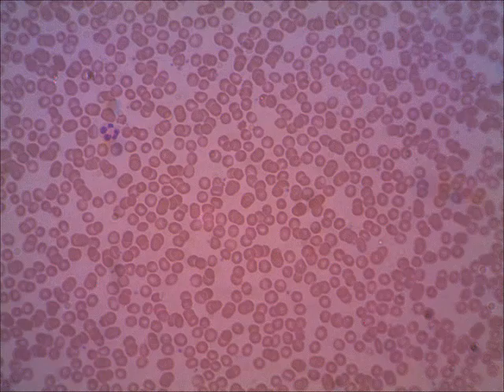Here's another view of a neutrophil. You can see the nucleus is so lobed it almost looks like there's more than one nucleus there. They do connect. The lobes do connect. And then the cytoplasm is kind of nondescript. Notice these tiny little purple dots I'm pointing to. Those are some platelets. You're going to see these in several of the slides, tiny little platelets.